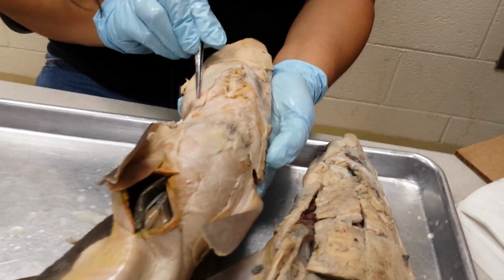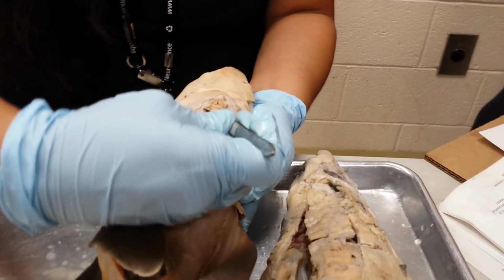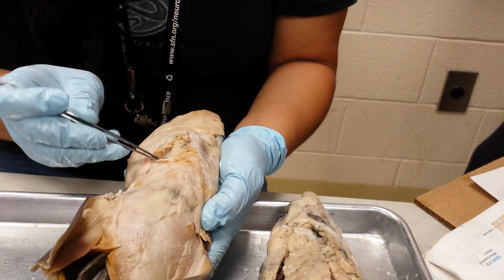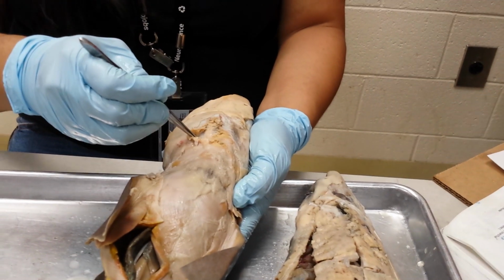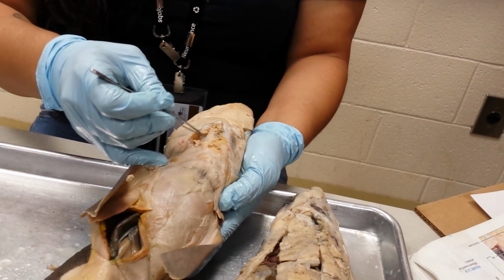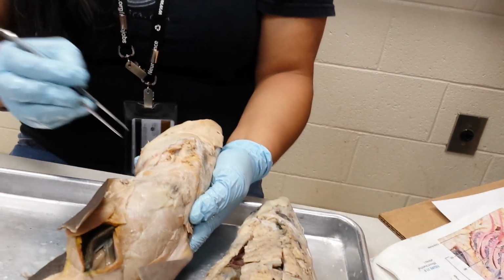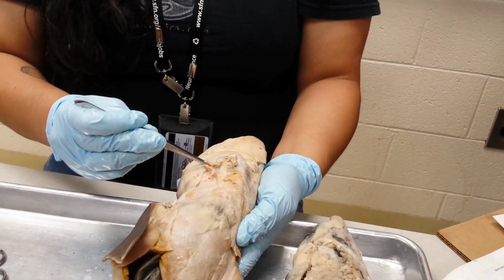Remember, you have the intermandibularis that runs on the outside between the two mandible bones. It's actually two layers of muscle. When we flip over the intermandibularis, you can see that the second layer of muscle runs underneath. That's called the interhyoideus. They're hard to separate, but it's two layers. The top layer is the intermandibularis, the bottom layer is the interhyoideus.